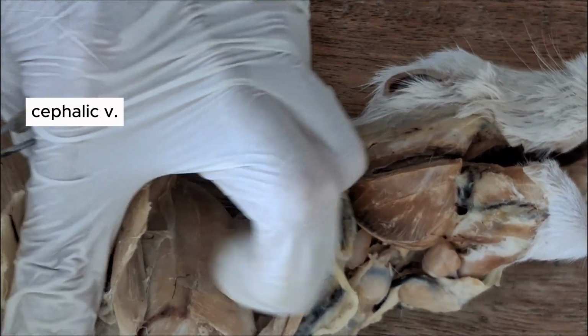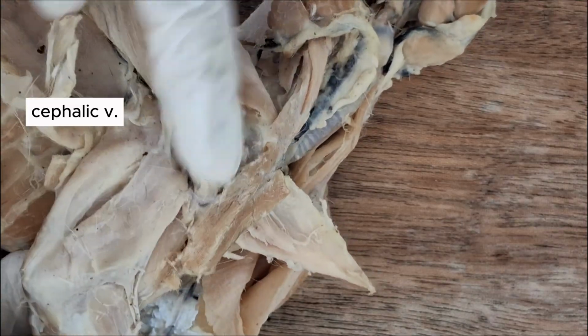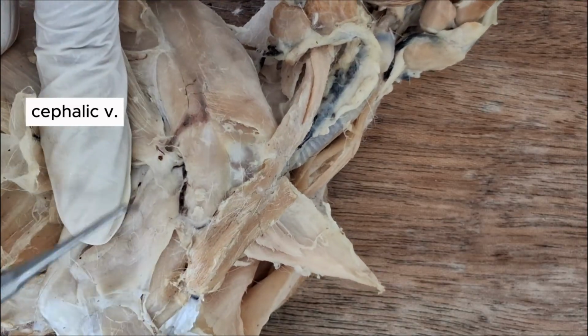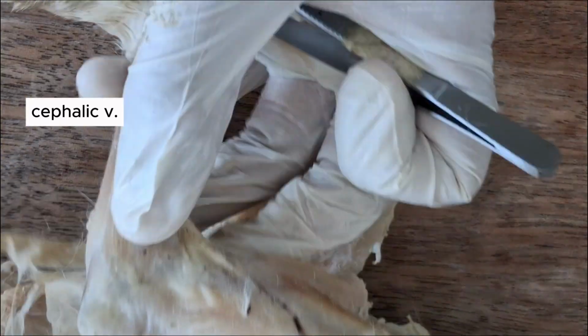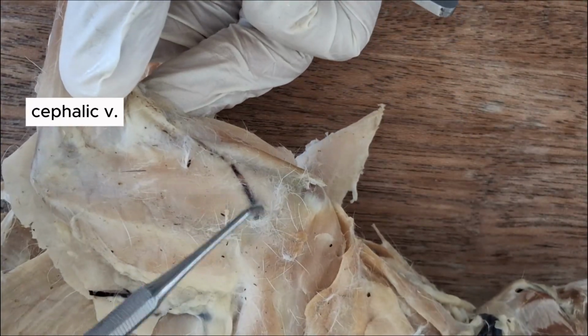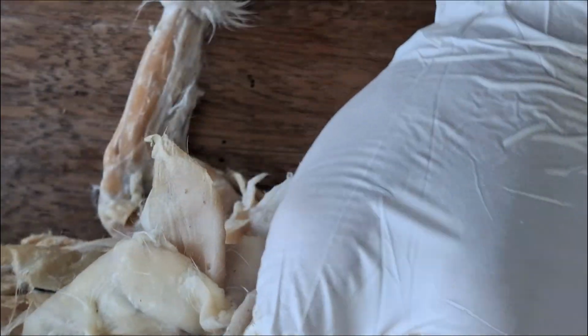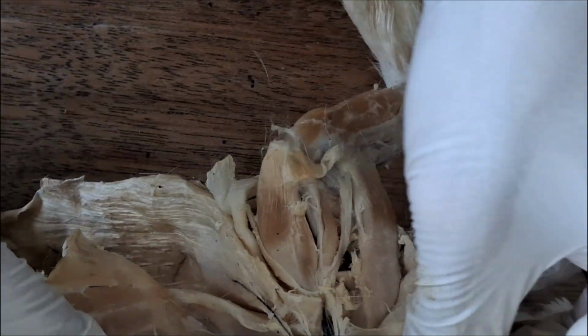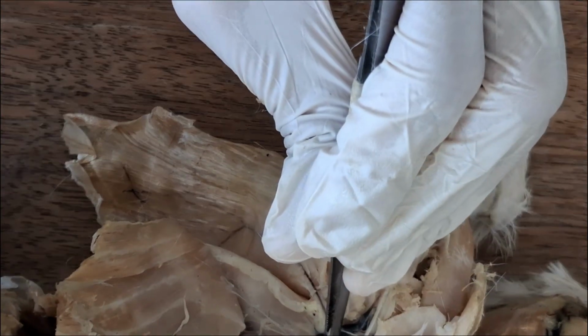So you see this vein on the side, the shoulder, lateral side. This is cephalic vein. It's also seen on the other side, cephalic vein. Now blood from here goes all the way to the medial side, becomes this one.